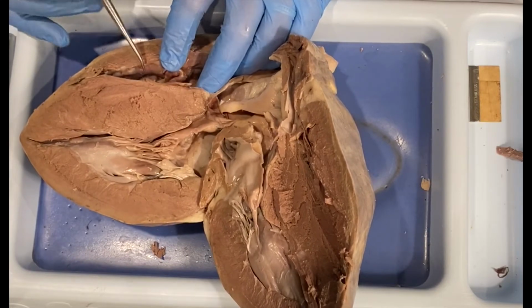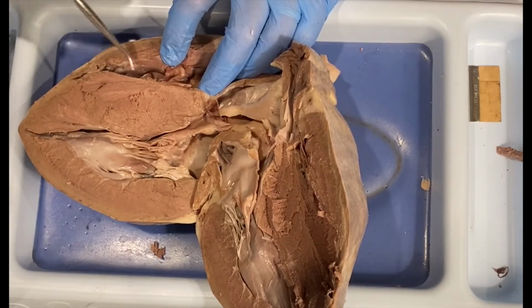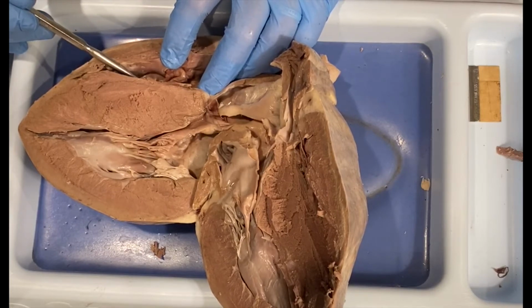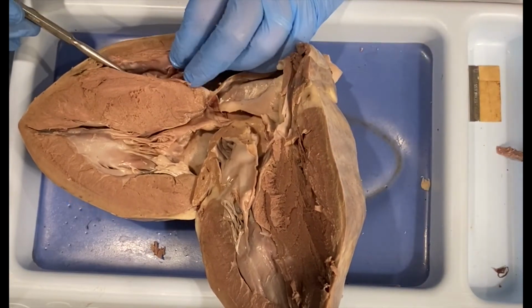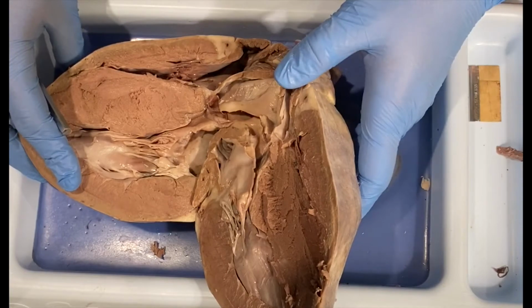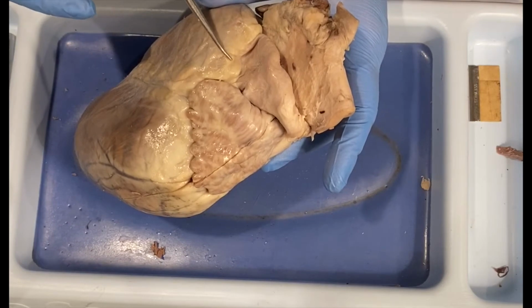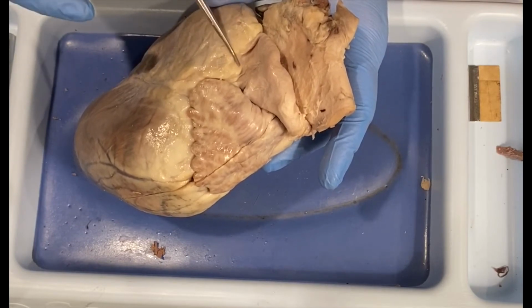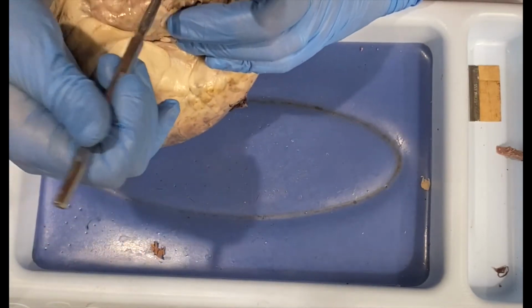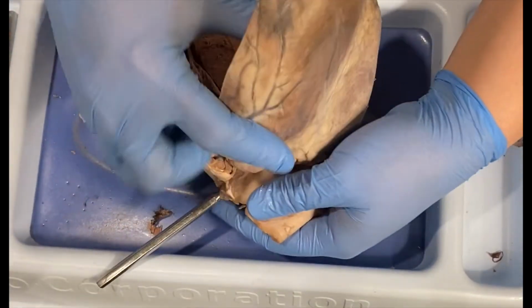Now, once the deoxygenated blood gets into the ventricle, it is going to pump from the right ventricle through the pulmonary trunk into the lungs. Now, this side of the heart, because of how much muscle is over here, makes it very difficult to see where that is going. So I'm going to close this back up to show you that that blood would go through the semilunar valve, which would be the pulmonary semilunar valve, and goes through the pulmonary trunk.